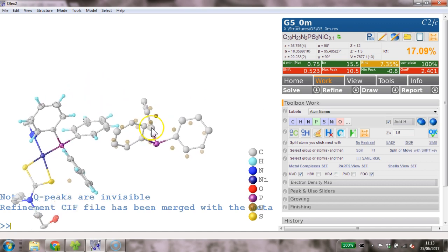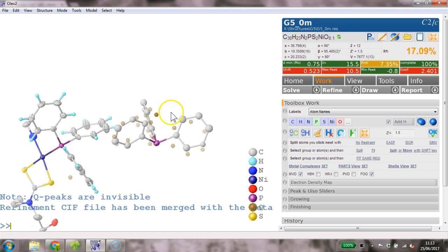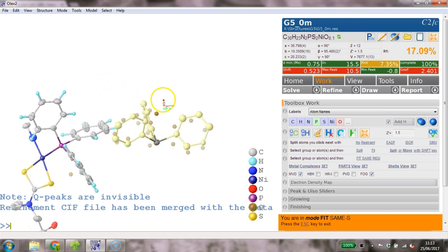So we're just moving this over. That's Shift and Control with the left mouse. Right, I'm hiding those Q peaks again and double click on the entire entity, and the command is mode fit -s, and then same. That also puts restraints in. Now switch the Q peaks on again. That phosphine has disappeared up here, so just cycle through. It's up the top now. And I grab it with the left mouse, and I don't press any other keys, and I just move the phosphorus up there, and then I can also twiddle the whole thing into position.